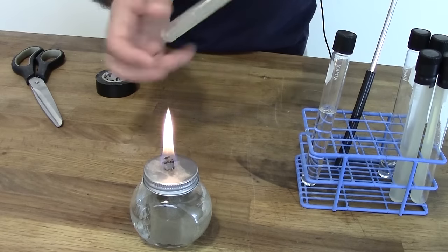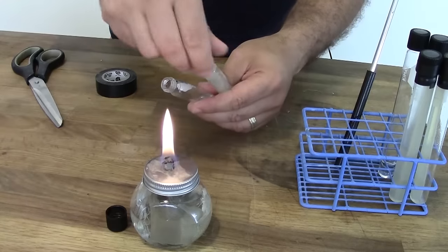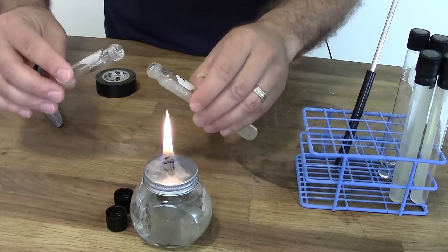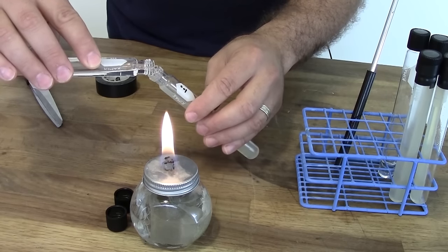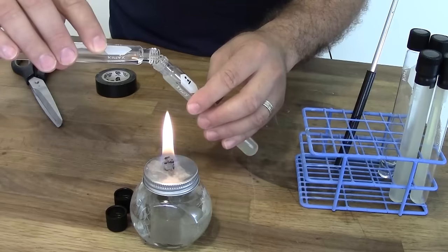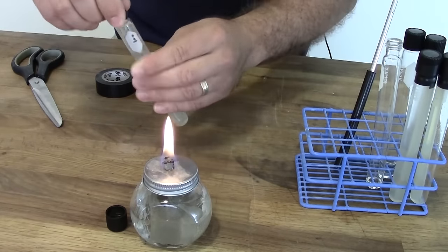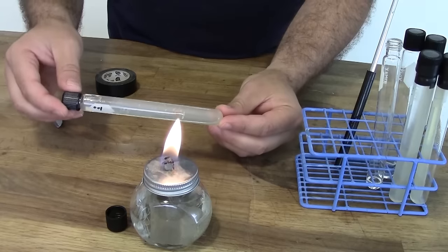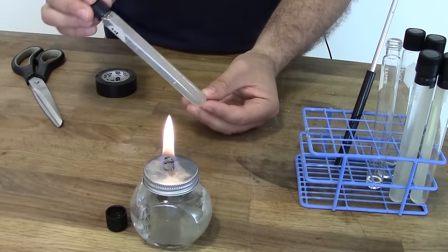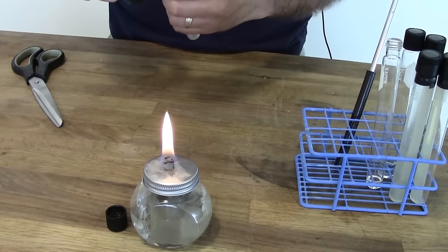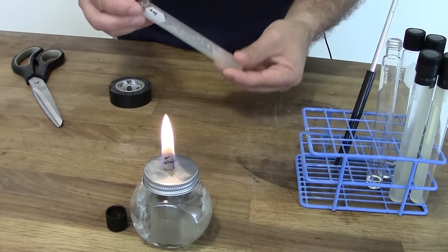Stored like this cultures are good for in most cases a year. I've had a few strains that lasted not quite a year like this, but most strains of yeast stored in this fashion are good for a year. But what if we really want to store these for a long time. Well that's where the mineral oil comes into play. And the idea here is exactly the same as with the water. What we're going to do is use this to fill in again the air space inside of this slant, but this time of course with mineral oil. So again we're going to pull the caps from these tubes. We'll flame both tubes. And we'll fill with mineral oil. Now mineral oil will cause these slants to last a lot longer. I've used slants like this that were up to 3 years old without any issue. I've never pushed it longer than that, but there's no reason to believe it wouldn't. There are actually reports in the scientific literature of slants stored like this lasting more than 30 years.